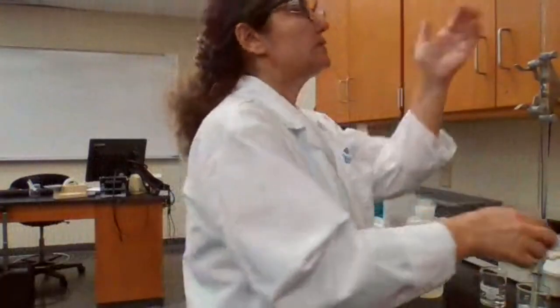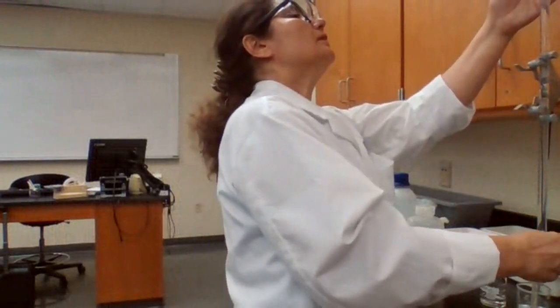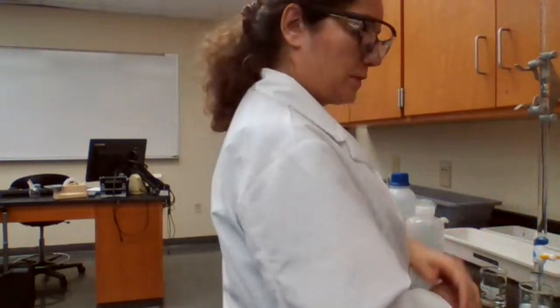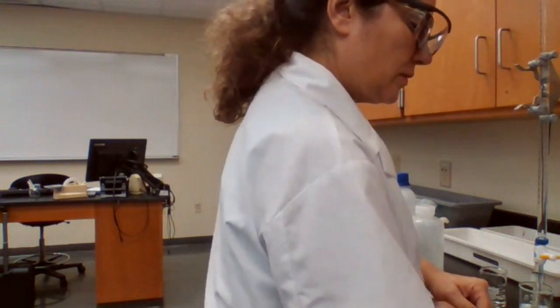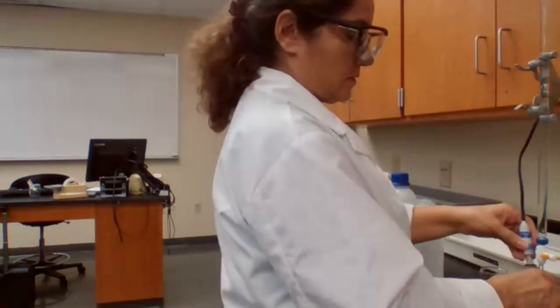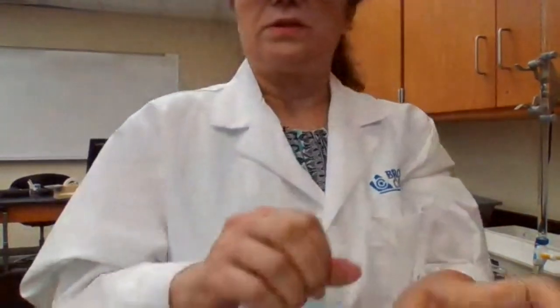Okay. Now 12.5. I'm just writing it in the table ready so I don't forget the numbers. 12.5 is 5.7 and 13 is 6.1.